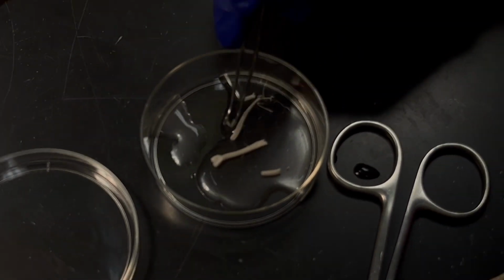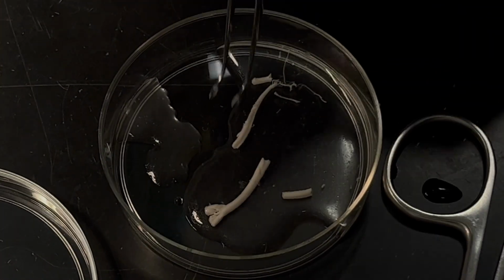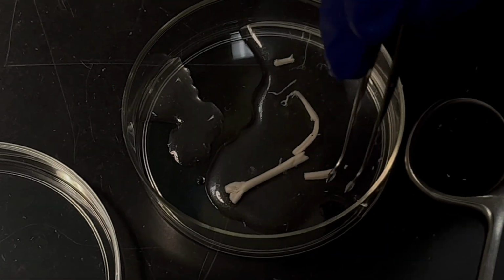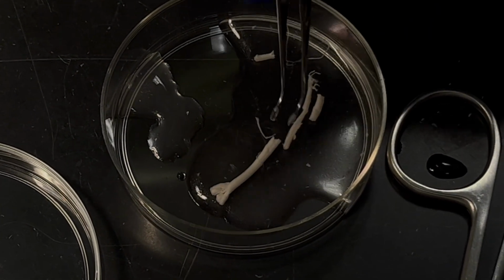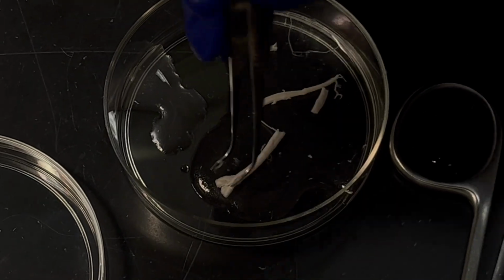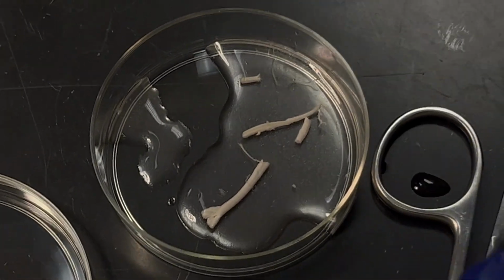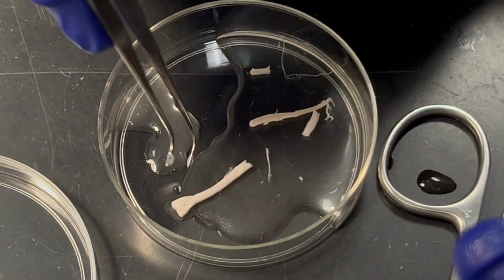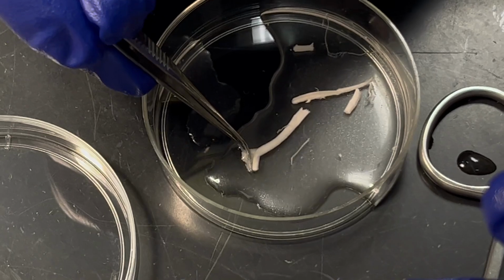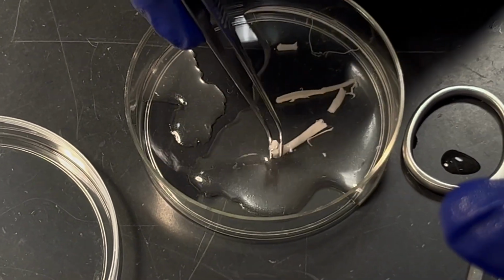I have a question. By broke, what do you mean? Like this. So this was like this. Part of the whole spinal cord was like this, okay, then it broke, and when it breaks, the issue is that you need to find which side is which, which is hard to find then, right? If you have the whole thing, maybe next time, then it's easier.